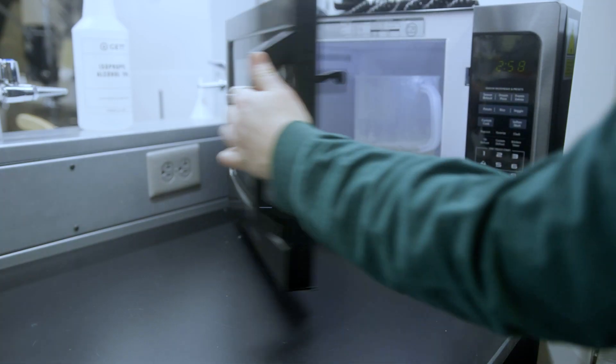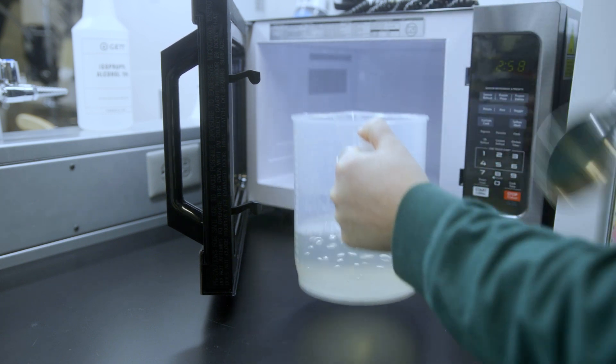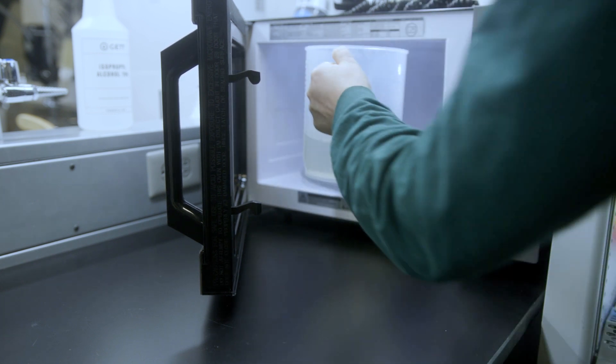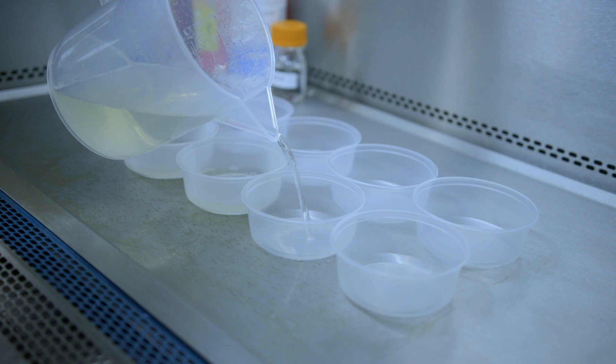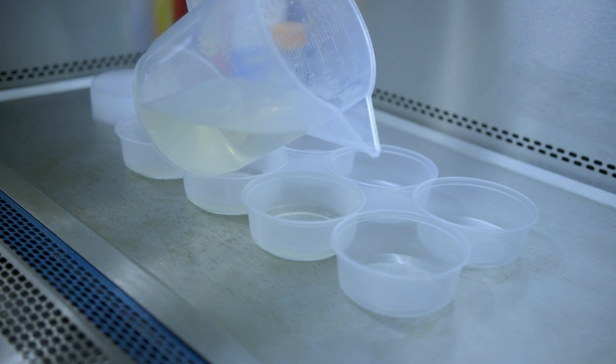The agar mixture is brought to a boil, stirred, and boiled a few more times to ensure that it is mixed. The plates are poured under a biosafety cabinet and allowed to cool until solid.